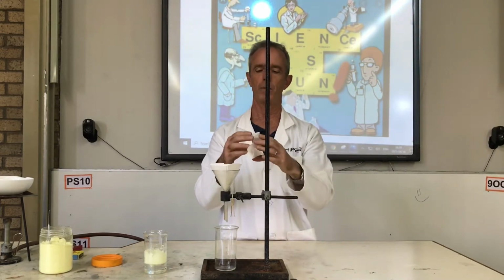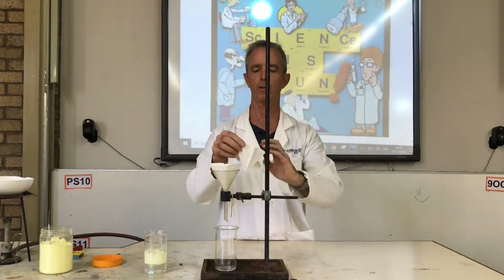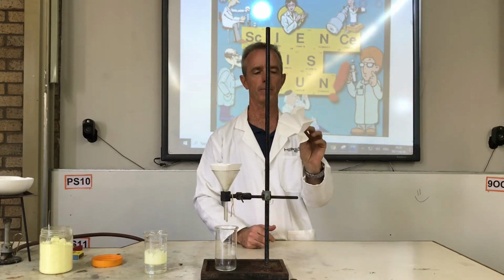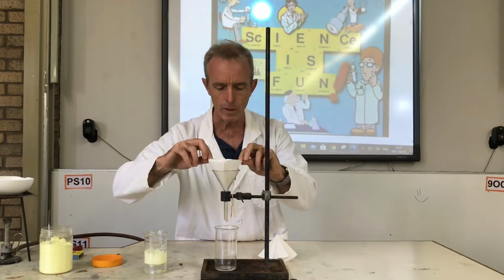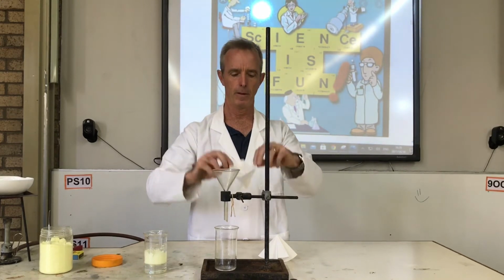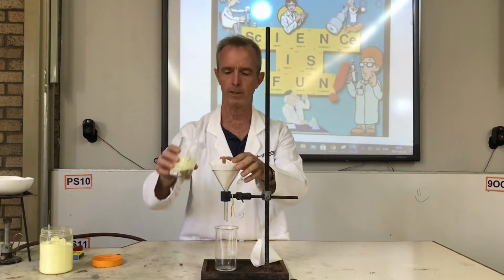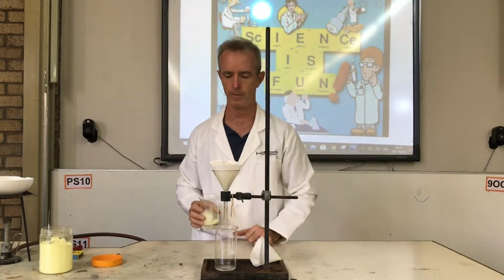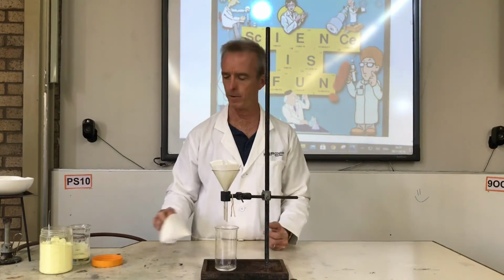And then when you open it up, what you'll find is that you've increased the surface area, and if you increase the surface area, the water will run through a whole lot quicker. So let me show you what I mean. If I take this out now, you can see that the water has run through and the sulfur is left on the paper. But if I put this piece of paper in now, because there's a greater surface area, the water should run through a whole lot faster. Which just means that filtration happens a lot faster.